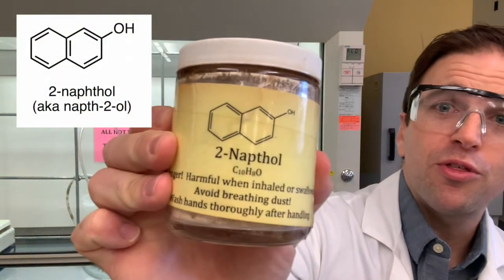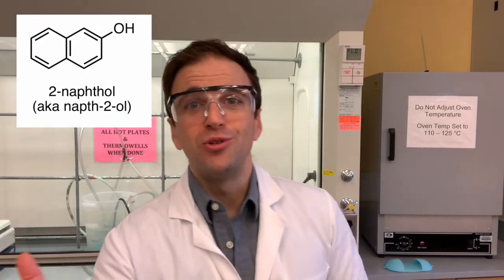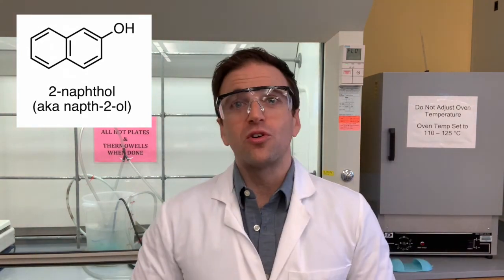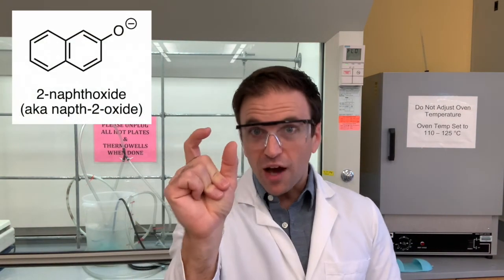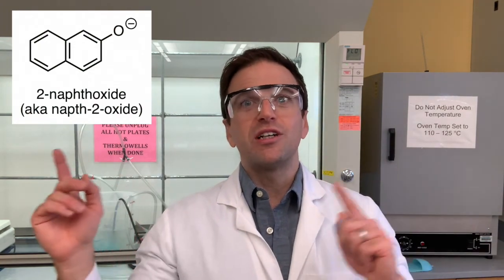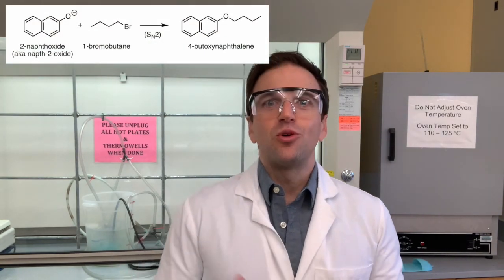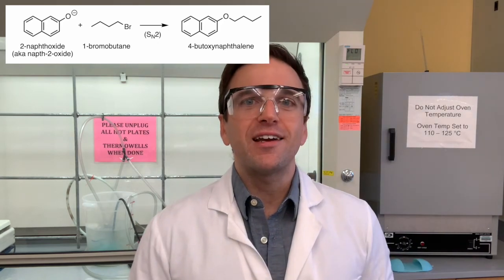We're going to take this compound right here, 2-naphthol, you can see its structure, and we're going to deprotonate that alcohol group with sodium hydroxide to generate the naphthoxide, the O- on the naphthalene structure, and we're going to take that alkoxide, treat it with bromobutane, and perform an SN2 reaction. So this will be our first synthetic organic chemical reaction that we're doing in the laboratory.